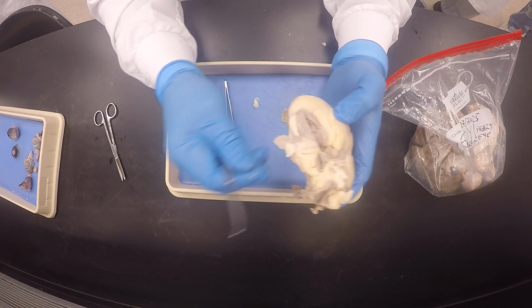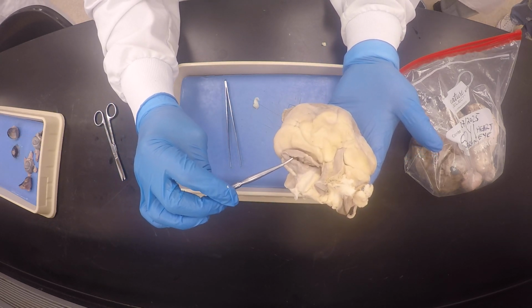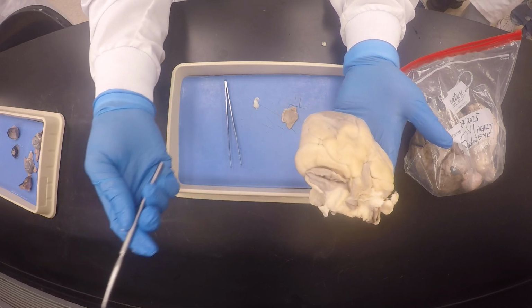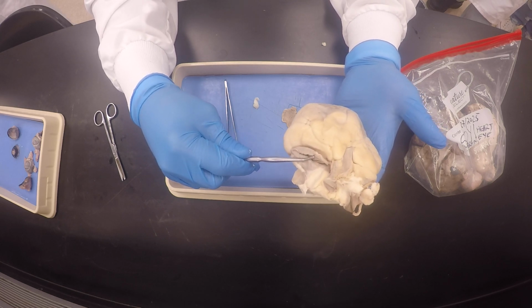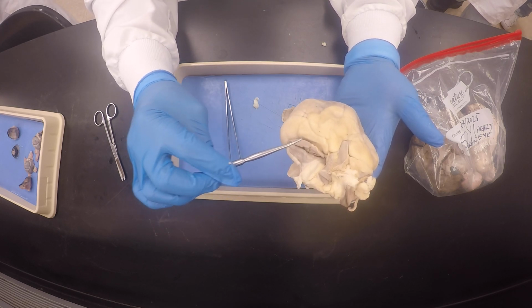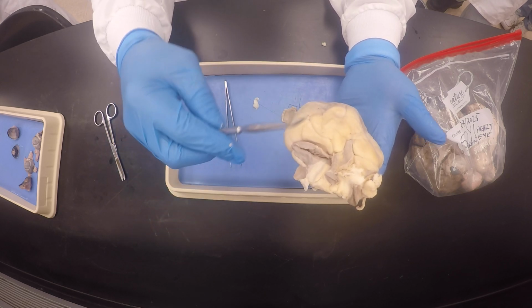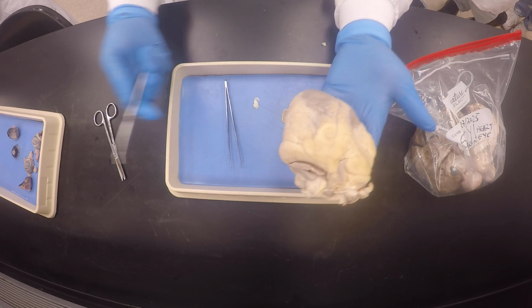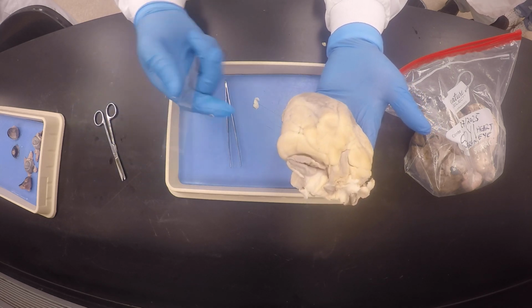Okay, the pulmonary veins, usually you never see them. But for instance, if I was to point towards the left auricle and ask what is that major blood vessel, you would have to say pulmonary veins, because there's 4, right? But if I was to say what's the structure, you'd say left auricle. Do you see what I'm saying, my good friends? So don't see the arrow pointing to the auricle and immediately think left auricle. If I'm asking for a major blood vessel, remember that when they got this heart, they cut them off. They were not intending for them to come to the anatomy lab. So that's why you don't see them.